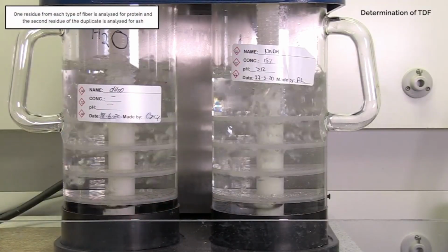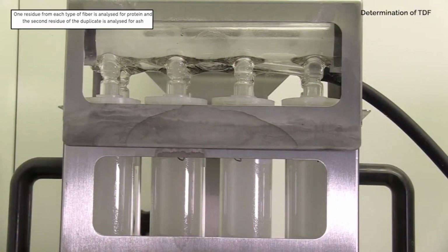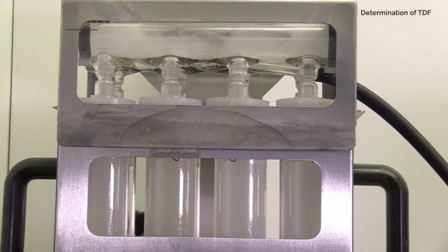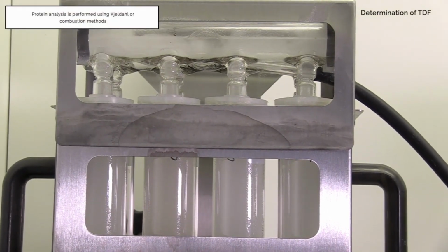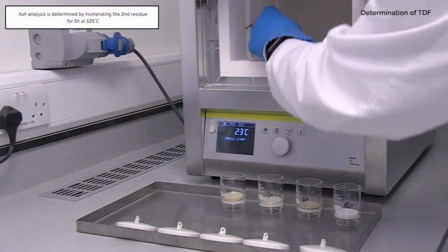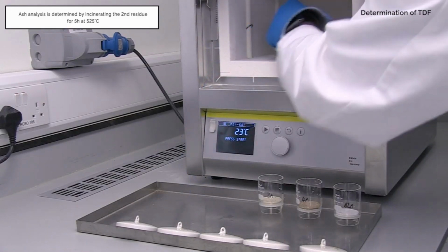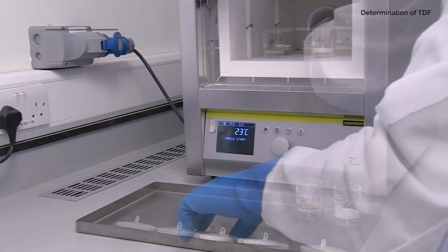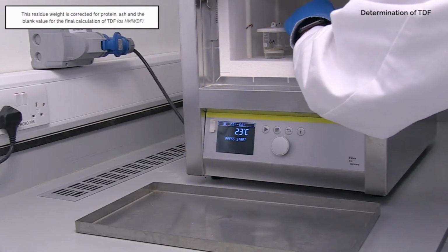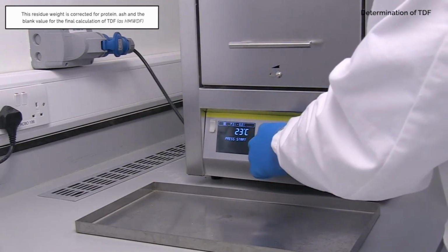One residue from each type of fibre is analysed for protein, and the second residue of the duplicate is analysed for ash. Determine protein and ash weight in grams. Protein analysis is performed using Kjeldahl or combustion methods. Ash analysis is determined by incinerating the second residue for 5 hours at 525 degrees Celsius. This residue weight is corrected for protein, ash and the blank value for the final calculation of TDF as high molecular weight dietary fibre.